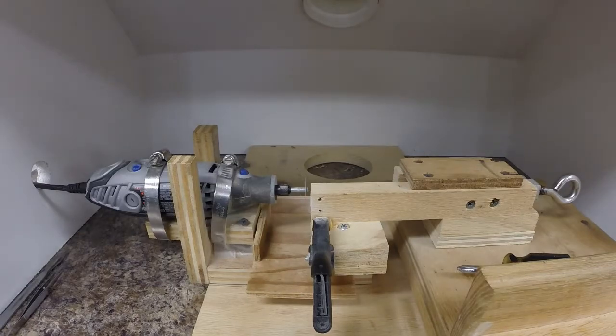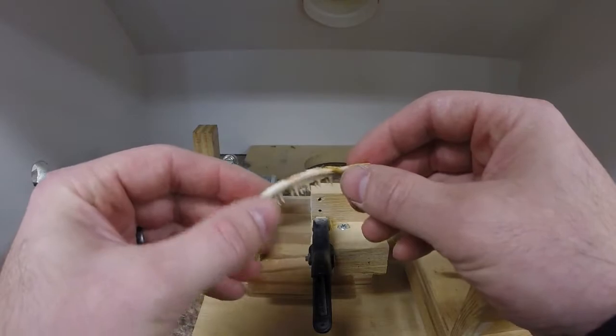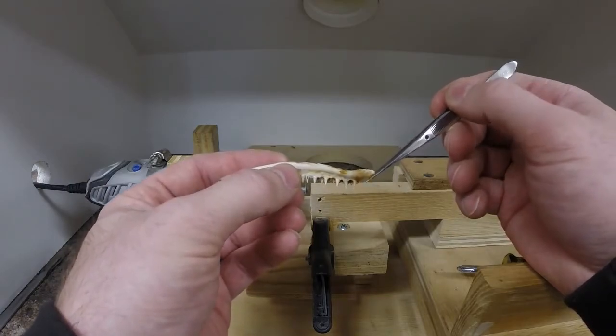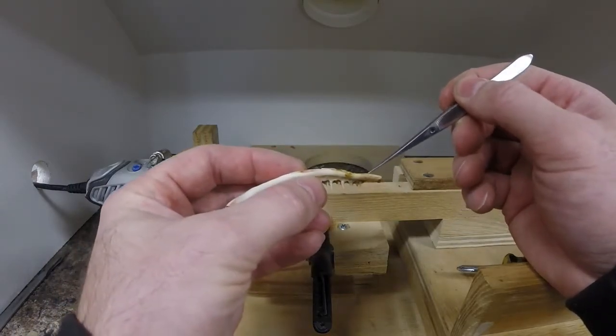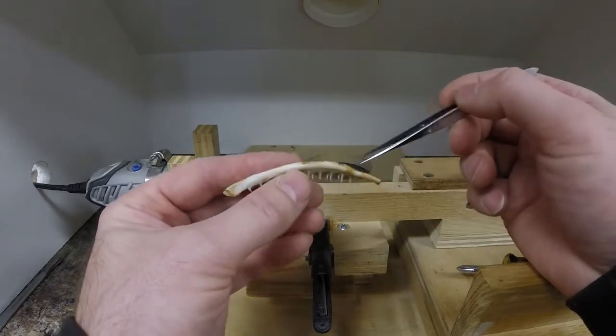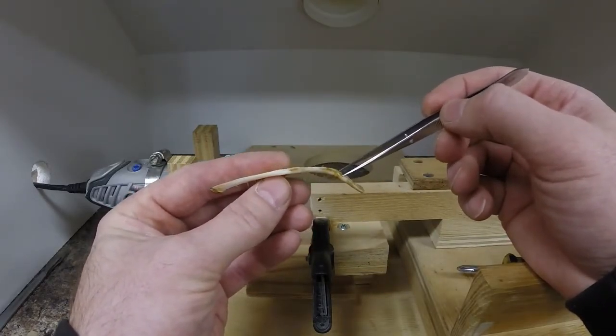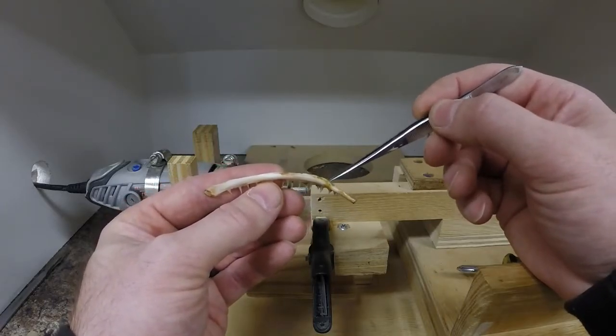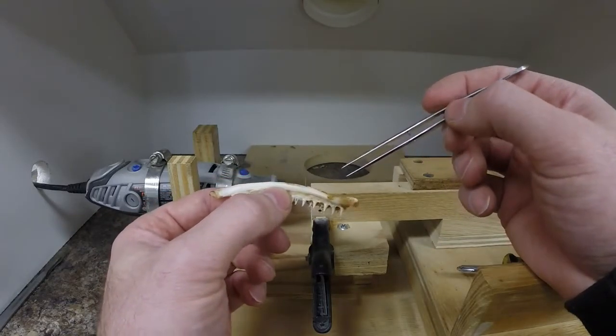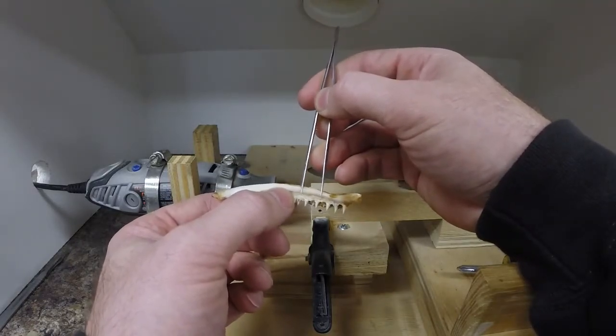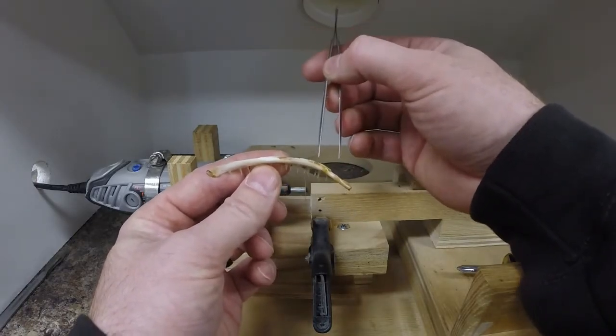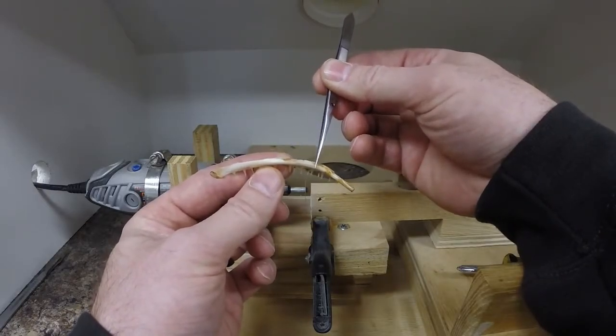Where to take sections of the maxilla? So this is a lake trout maxilla from the left side of the fish. The front of the bone is on this end, this would be the anterior end of the fish. This is the main portion where it actually attaches to the muscle. The back part, there's just a little membrane that attaches to the fish. This part right where it attaches to the fish, we call that the knuckle. It's where it really bends heavily. What we do when we section these is we cut it off as close to the knuckle as possible, and then we want to take our sections in the 25% anterior, 25% most anterior end of the bone remaining. So on this specific maxilla, I would make the first cut right in this area, right in here, and then take my three sections just behind that.